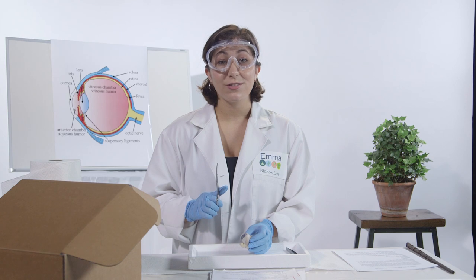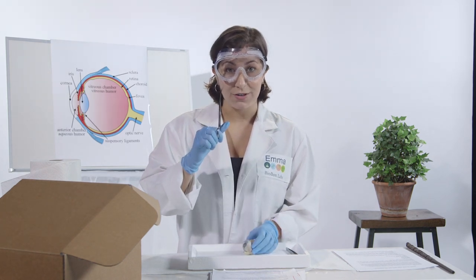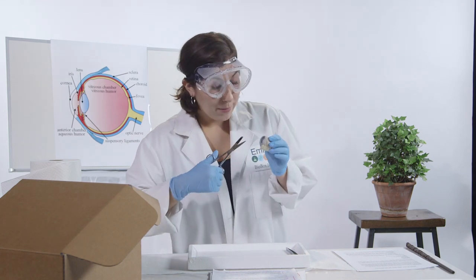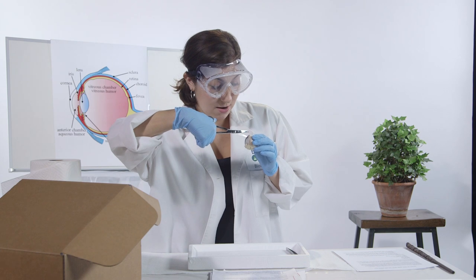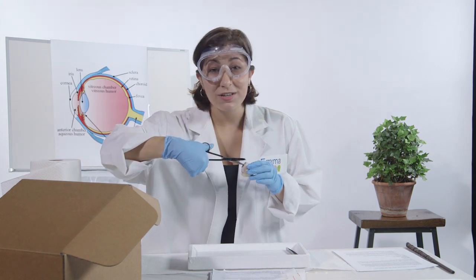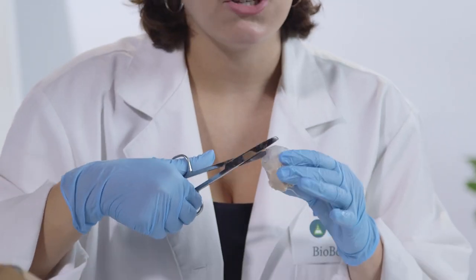So now, we're going to start the actual dissection of the eye. Make sure the pointy part of the scissor is on the bottom. We're going to make an incision right above the cornea. Now, before I begin, if there's some fluid that comes out, it's called humor. But let me tell you, it's not funny. The humor is a jelly-like substance that fills the whole eye.